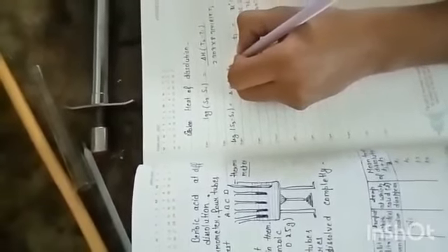Now we will calculate the heat of dissolving. We will calculate using 2 temperature values. We will take T3 and T1 for the calculation.